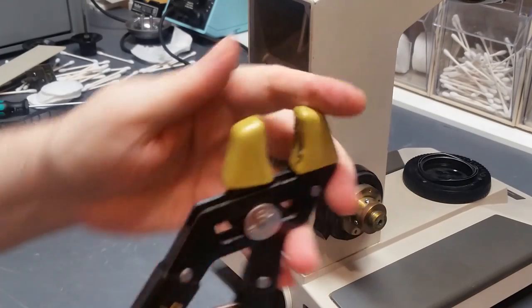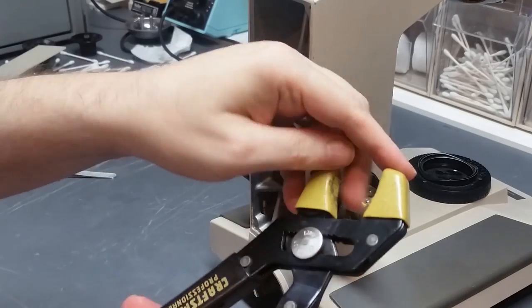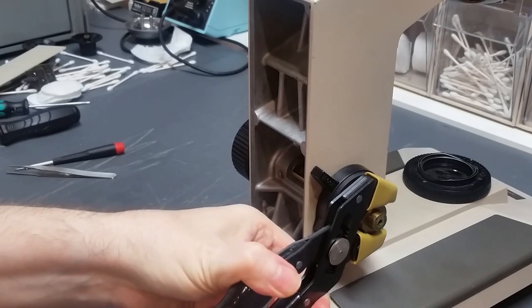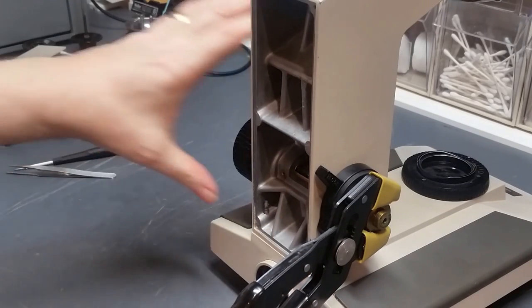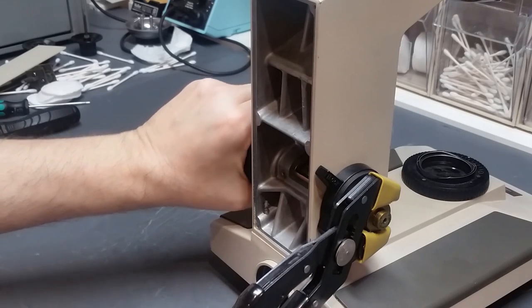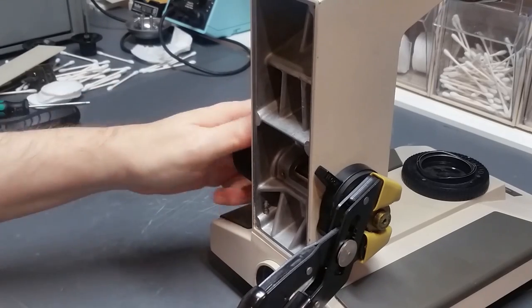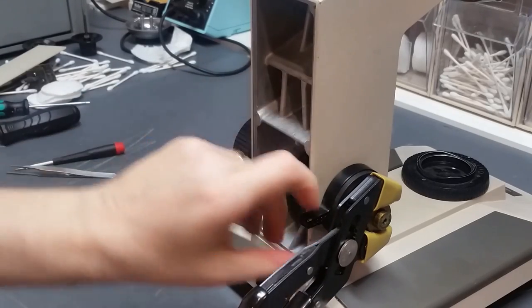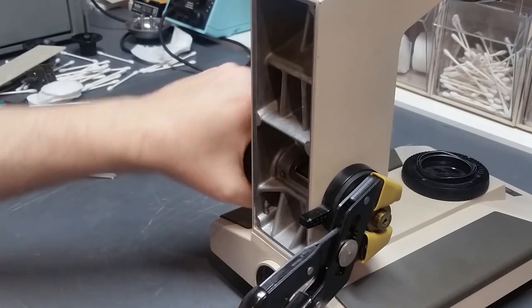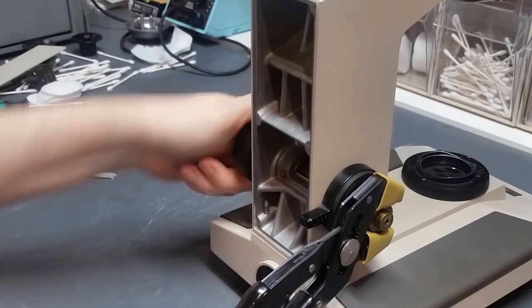take a pair of pliers with some kind of non-marring jaws. In this case, they're just plastic and they don't grip real well, but they will bite into these set screws. So if I hold this secure, reach over and turn the other coarse focus knob on the other side, it will loosen. I'm gonna release that preset before I go too much further. Don't want to damage the spring inside this. So I continue loosening until such time as this brass piece comes off.